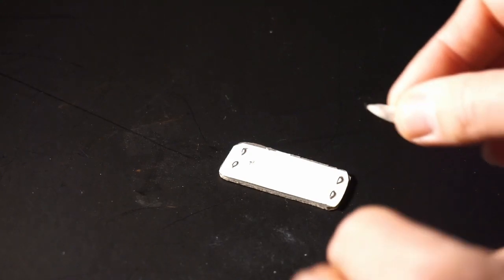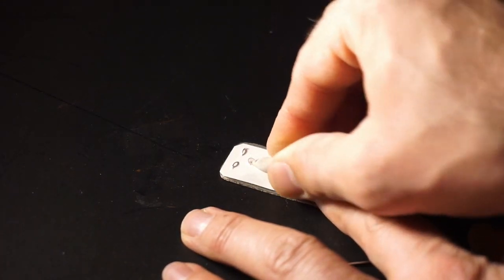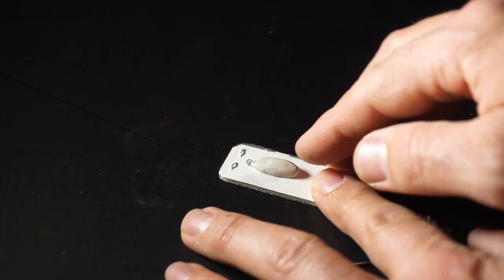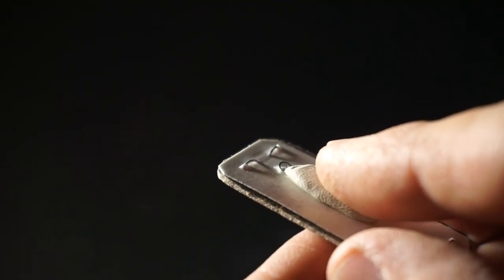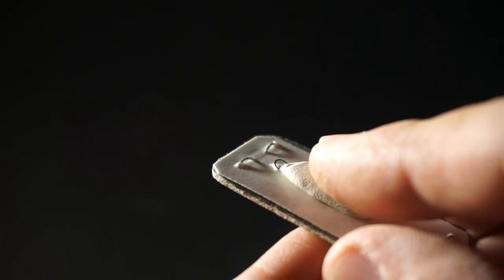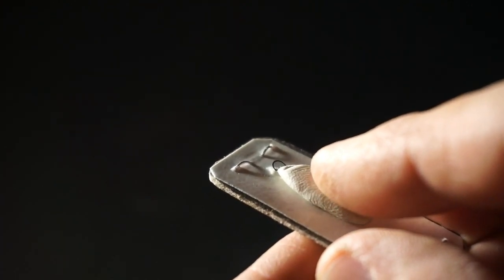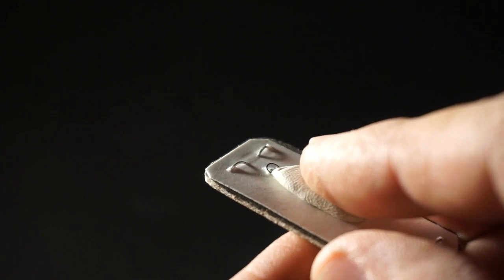The sample is mounted using sticky tack. So stick your sample to the sticky tack and then stick the sticky tack on the thin paper side. You focus it by pivoting. So you push your finger down and the sticky tack pulls the sample away from the lens. You push it up, it pushes the sample closer to the lens.